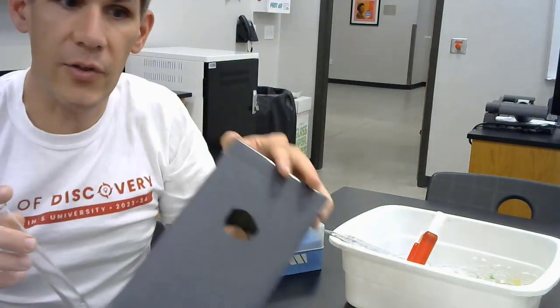You can see the string through the tube. That means the tube is clear. When we have red blood cells in the tube, when the blood cells are whole, it will look like this. You cannot see the little line through the tube. When the cells have lysed, you are able to see the black line through the tube.